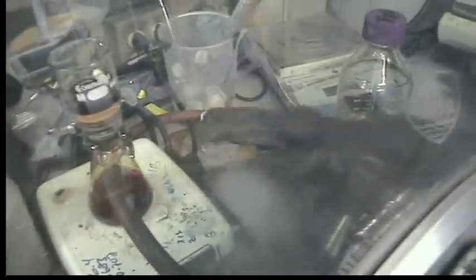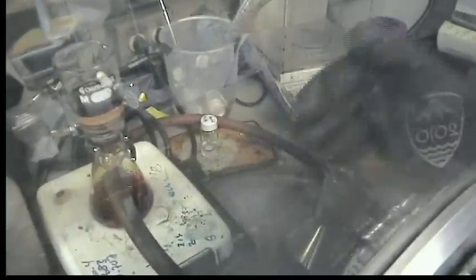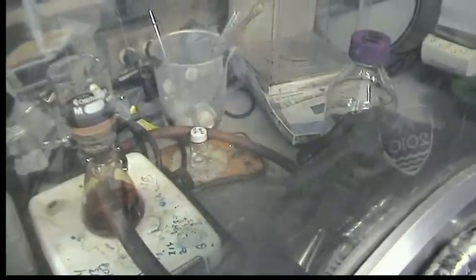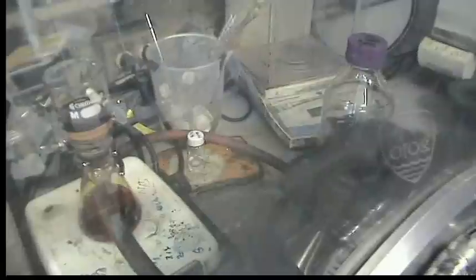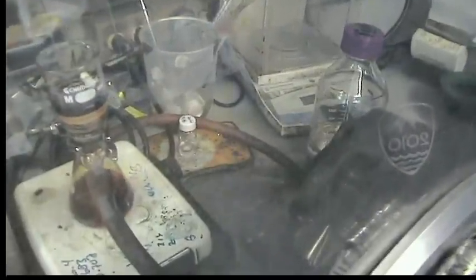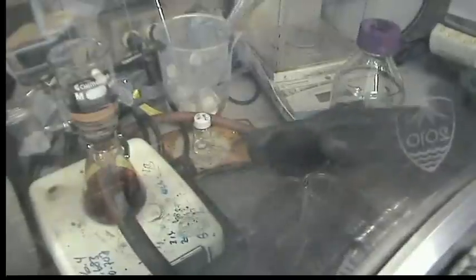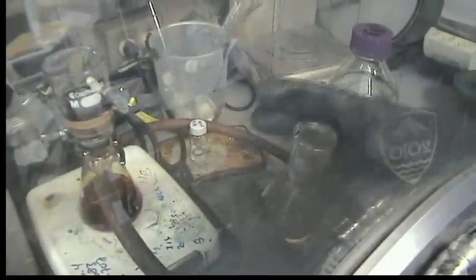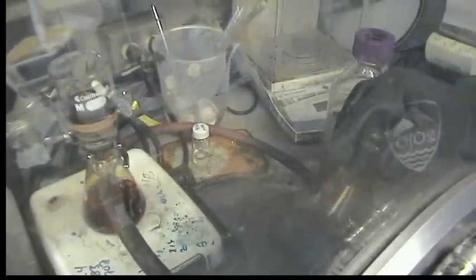So once I'm here, I never have seen any red phosphorus forming in the reaction mixture. The reaction mixture stays completely homogeneous the entire time. So I just do it as an extra safety precaution. Once it's dry and we remove it from the glove box to sublime, we're definitely going to cover that in aluminum foil.